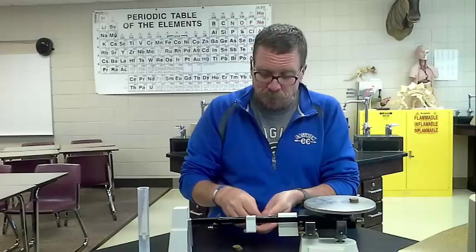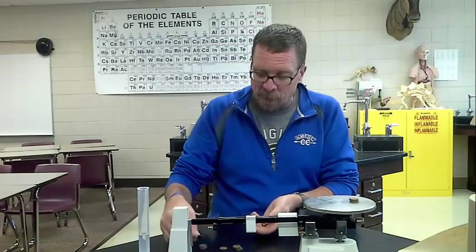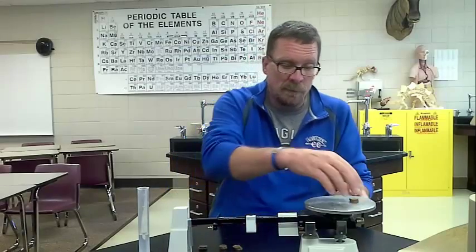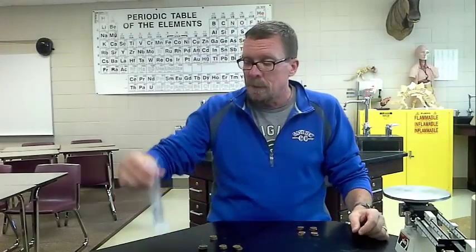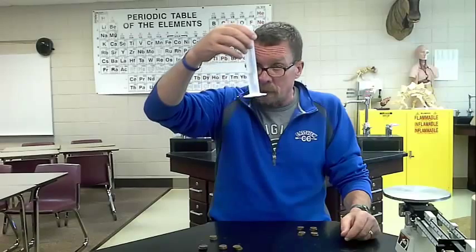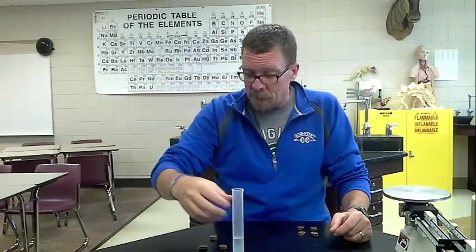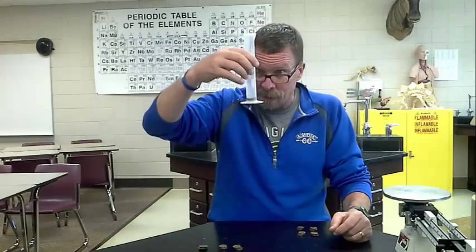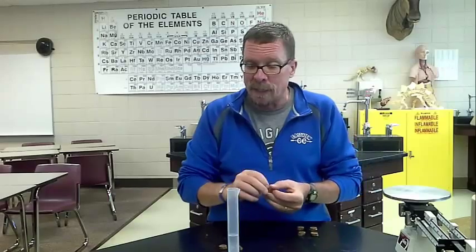Now, same thing. I'm going to take these pennies 5 at a time, and I'm going to check their volume. I do that by something called water displacement, which is using my graduated cylinder here. Again, I just took it to the tap, and I just put in some water. It doesn't really matter where it lands. What matters is I know where it starts. It's at 21 milliliters. So all I do is I take 5 pennies. In they go, careful of the splash. I now read the meniscus again. It's now at 23 milliliters. And I could record that down.